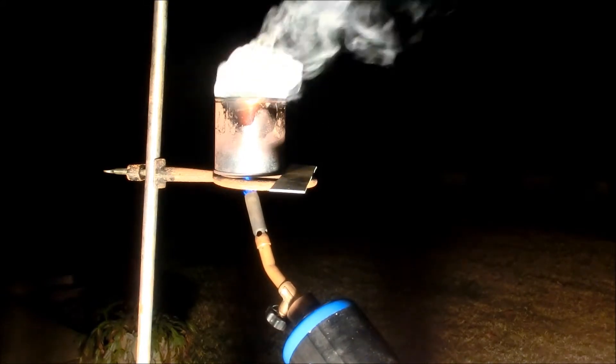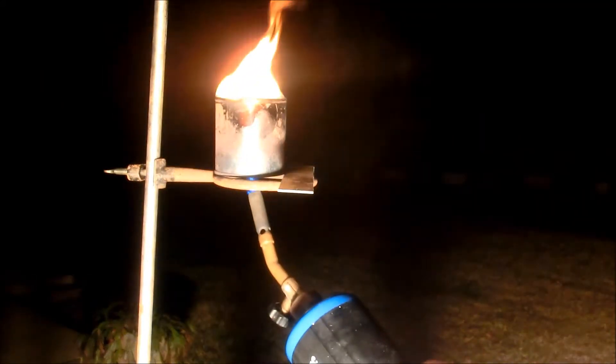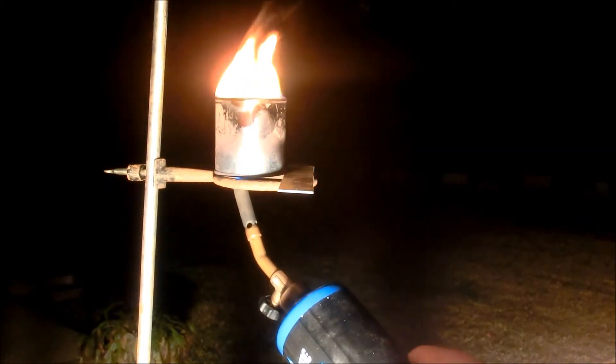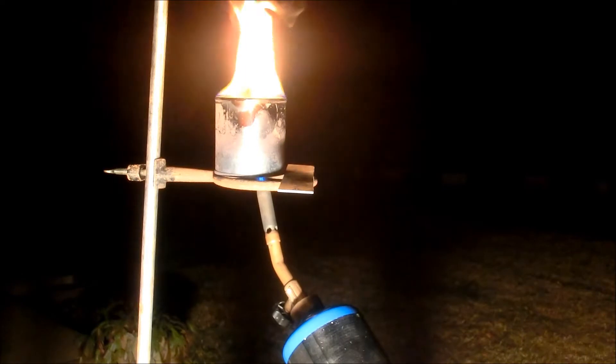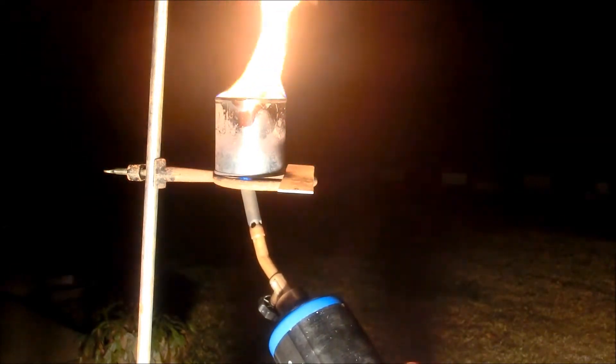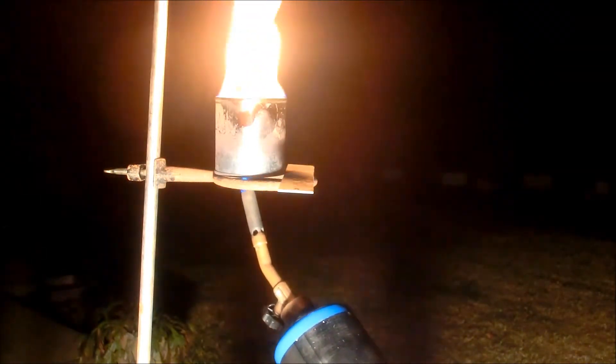And while you're heating, there will be a lot of fumes produced, and you'll see in just a second. You can actually light those, and they'll give you a good indicator of when the reaction is about done. Try not to breathe them. They're not too pleasant.